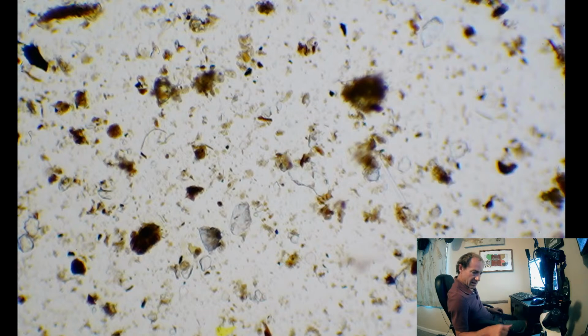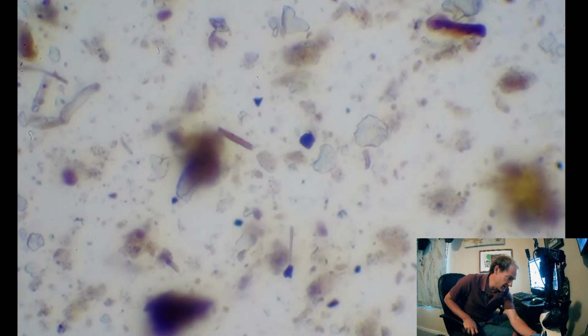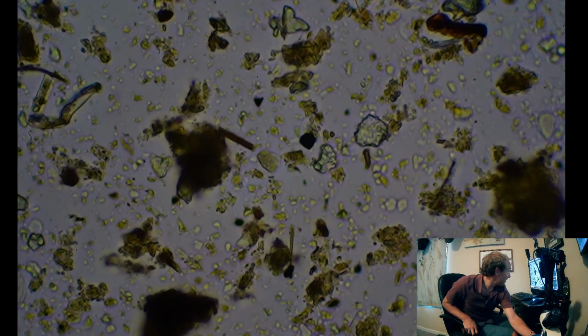And on that note, let us zoom in to 400x so we can actually see the bacteria. So we can actually get an idea of the ratios that we are talking about here. Alright, let's get focused. Oh, where we go? Don't bump into the side, please. Come on. Did I go past it? Oh, there it is. Whoa. Alright, let's put a little shading on this so things can get a little bit more in focus. Yeah, maybe right about there.